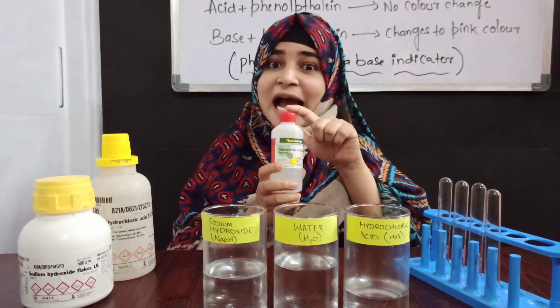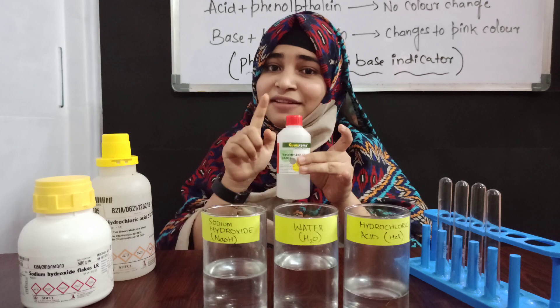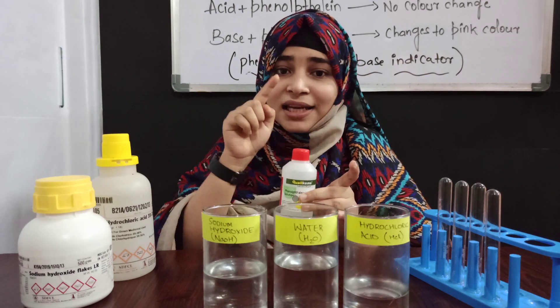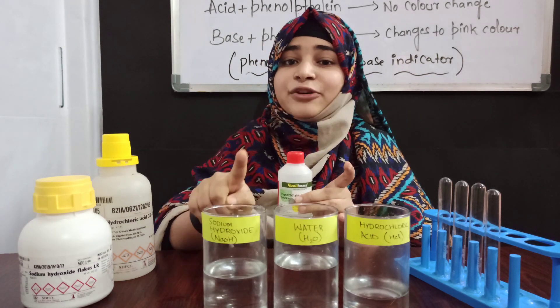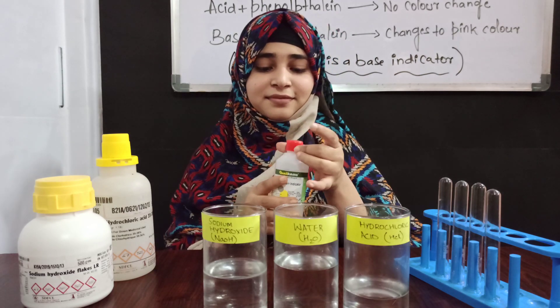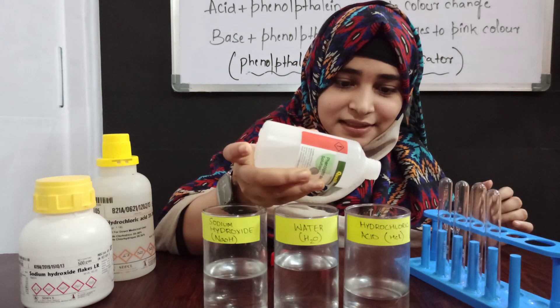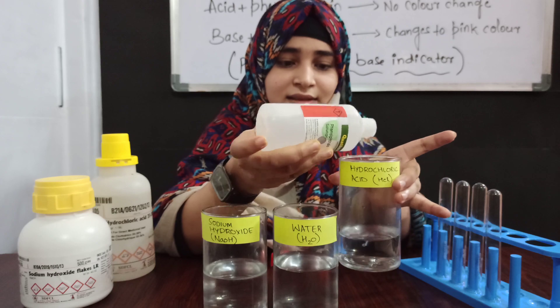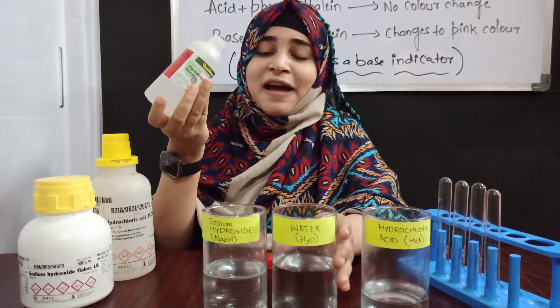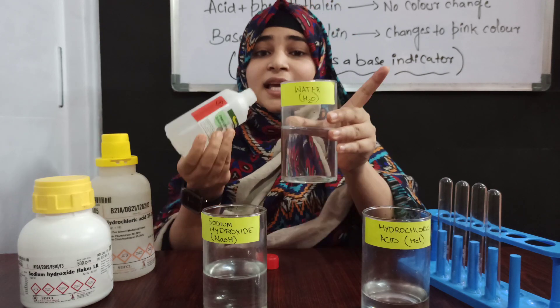This is the phenolphthalein solution, the base indicator. If I add phenolphthalein into the acid, there is no change in color. I am adding two to three drops of phenolphthalein solution into the hydrochloric acid — as you can see, there is no change, it remains colorless. If I add the phenolphthalein solution into the water, it also does not change its color — it is colorless only.